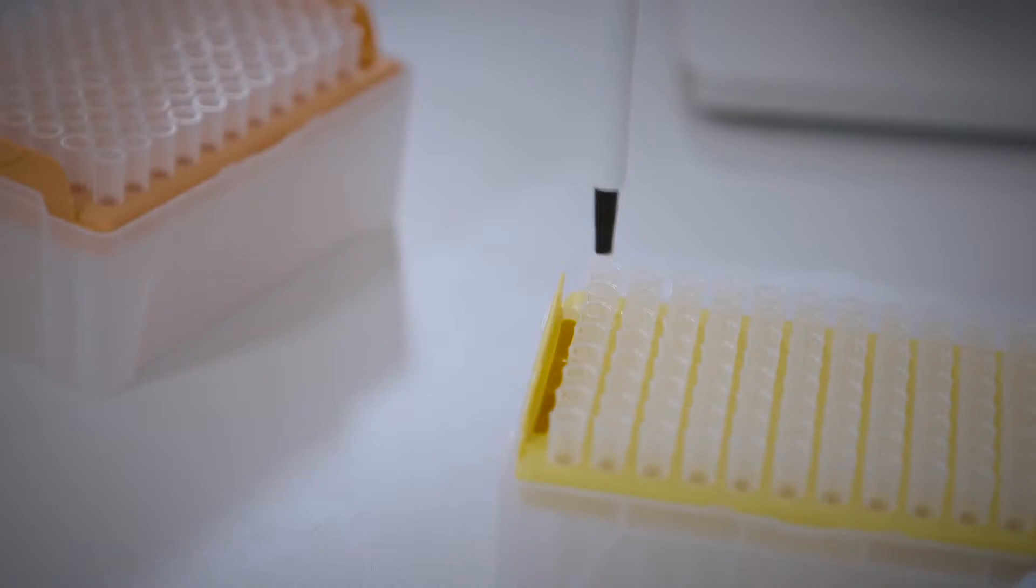When picking up tips, do not twist, only press to connect tips with pipette.